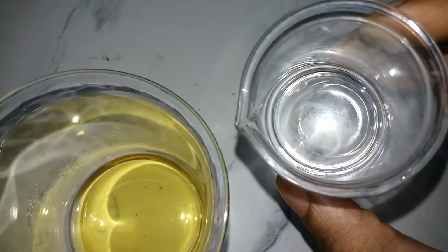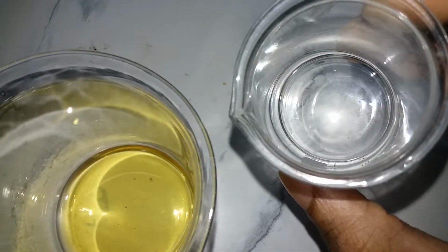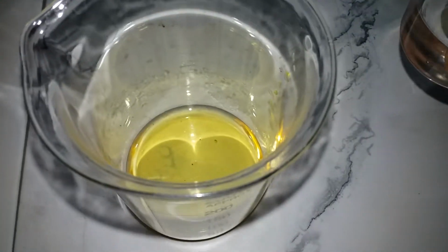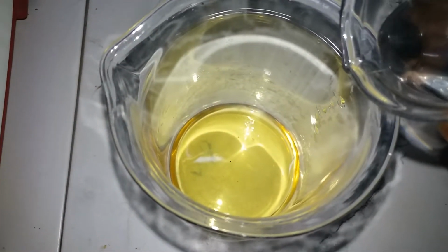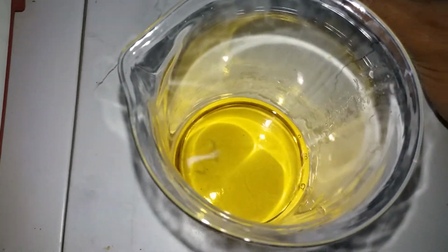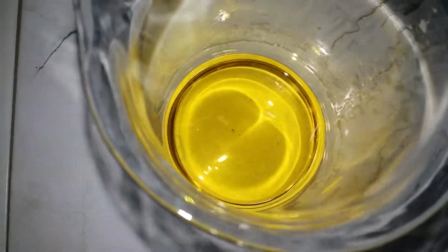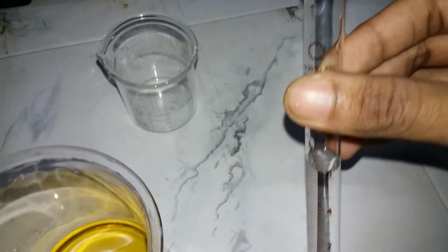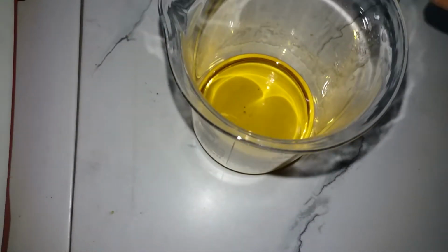Okay, now we're gonna add this sulfuric acid, and remember to wear gloves, and I'm out of gloves, so I'm not wearing any. So we're gonna slowly add it. Oh, what the heck. Okay, so again swirl it, and here we have our hydriodic and potassium iodide solution, potassium sulfate solution. And now we're gonna add 6.6 milliliters of hydrogen peroxide.